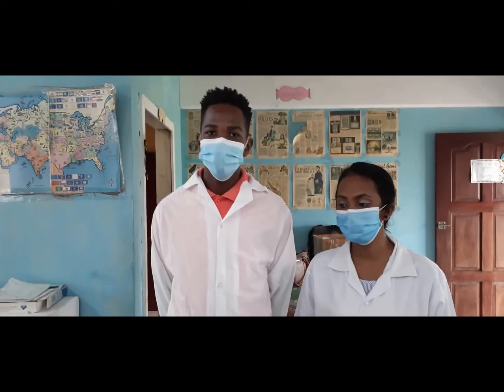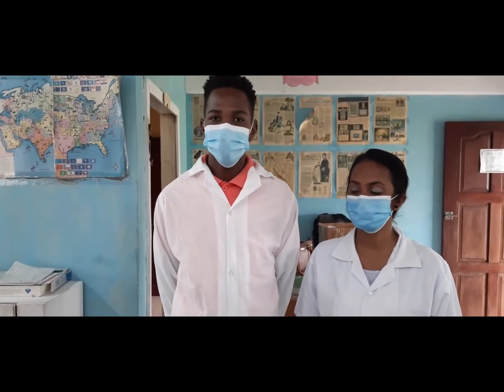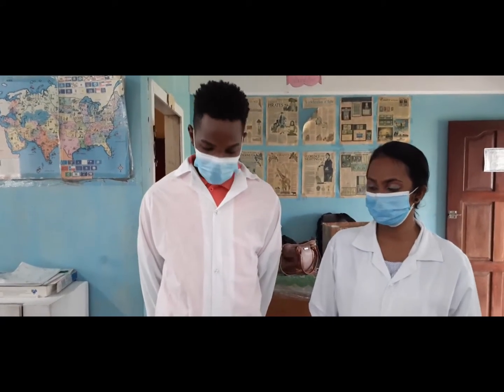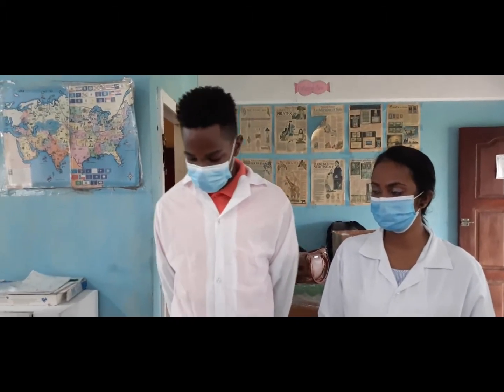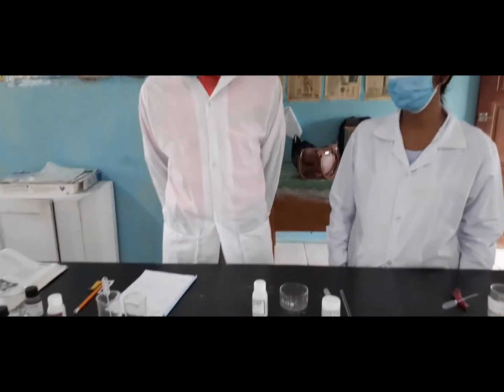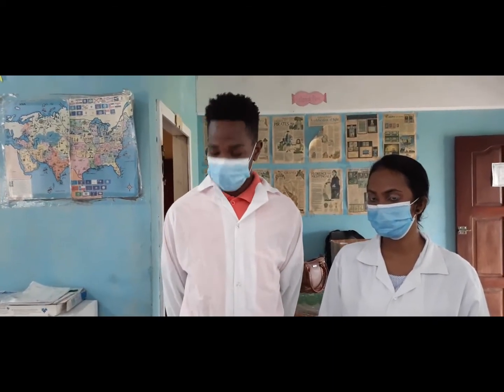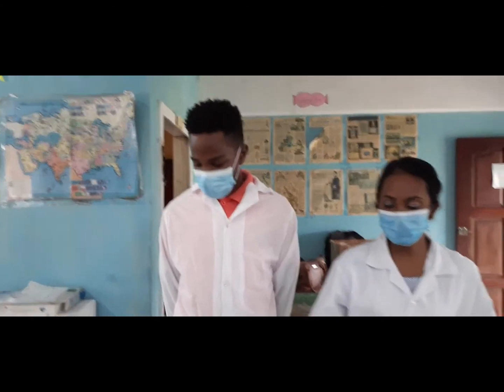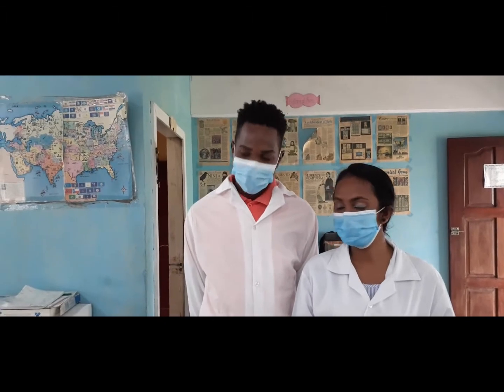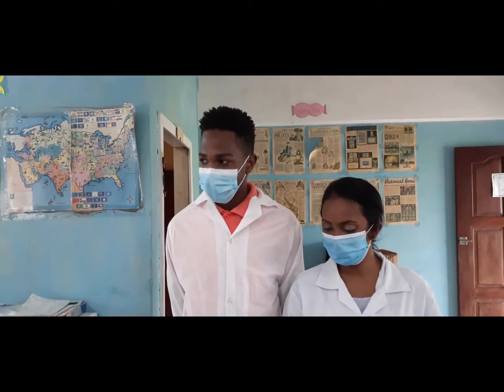Good afternoon once again. We're back again with our topic, acid, base, salt, and gases. But in this experiment, our title will be acid and base salt preparation. Our aim is to prepare a salt using an acid, hydrochloric acid, and a base, magnesium oxide. Good. So the principle that we'll be using is acid plus base equals salt plus water.